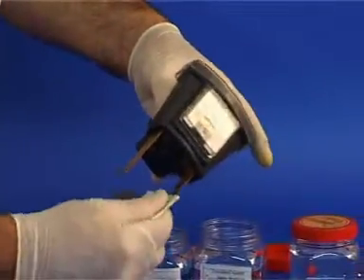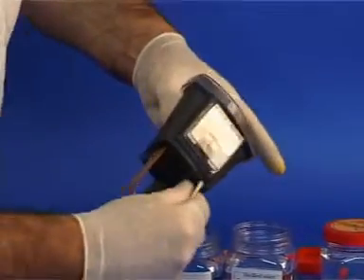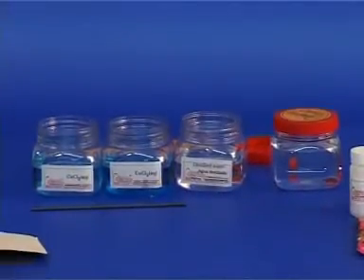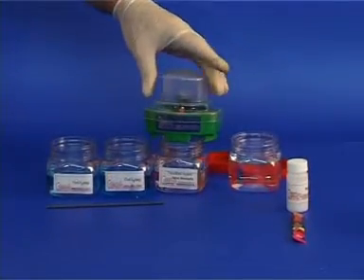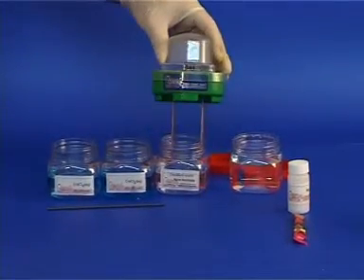The purpose of this experiment is to test the conductivity of each solution. Place both electrodes into the distilled water and observe what happens to the bulb.